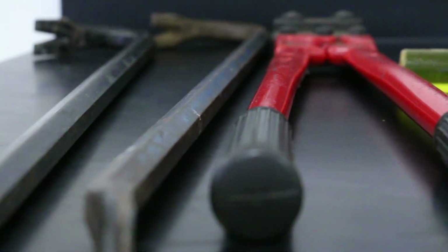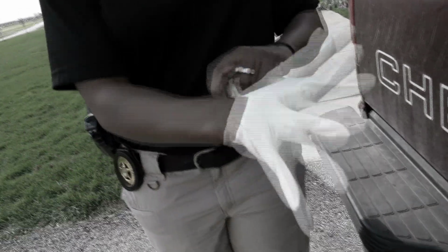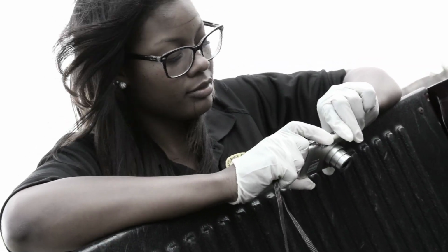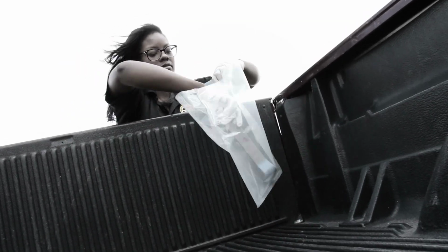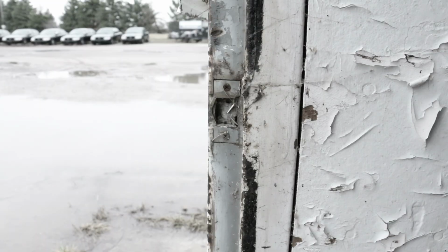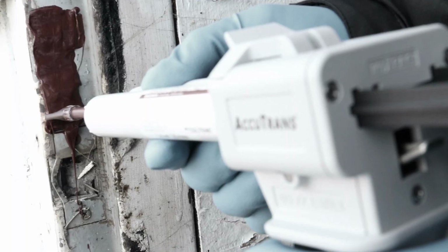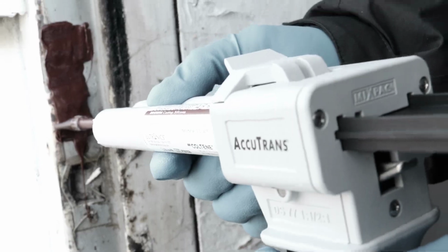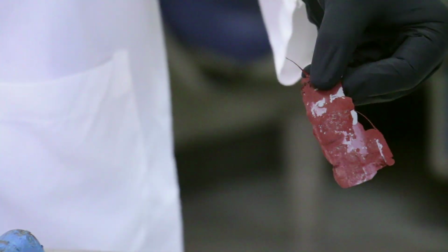We also examine tools that are used in crimes. That's what we're doing in Bob's case today. Remember, Bob's barn looked like it had been broken into. When agents were gathering some clues at Hwantu Bai's house, they noticed this crowbar in the back of his truck. So today what we're trying to figure out is whether this crowbar was used to make the mark found on the barn door. If you remember, the agents out in the field made a cast or an impression of that mark, and that's what this red thing is here.